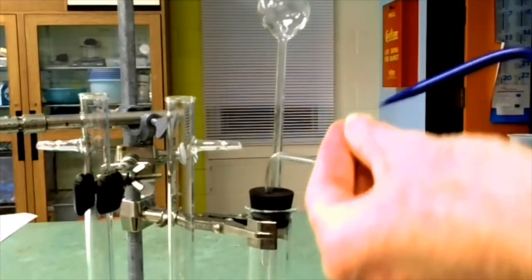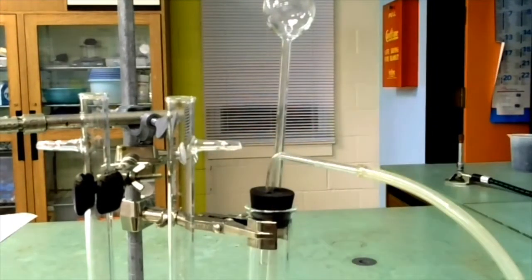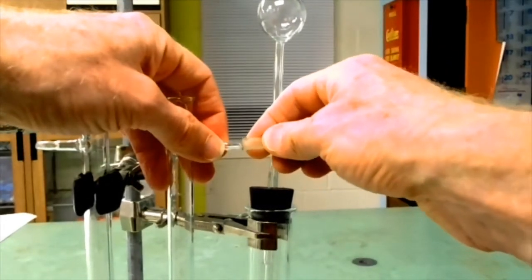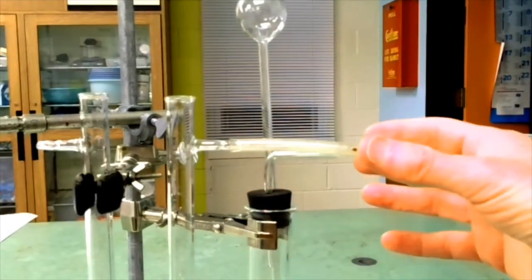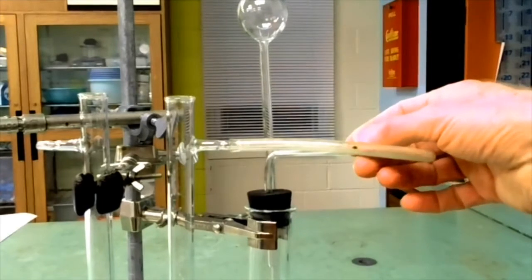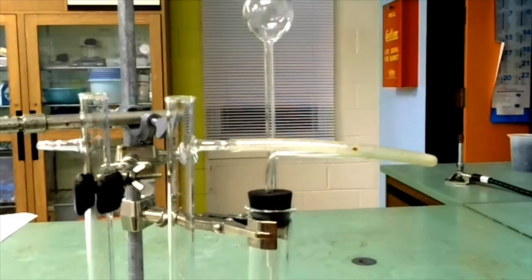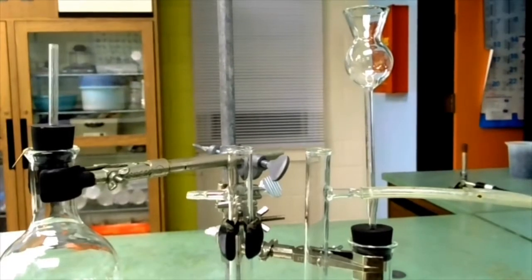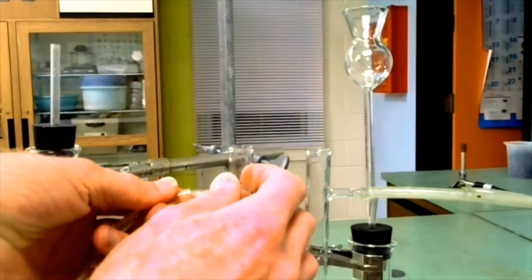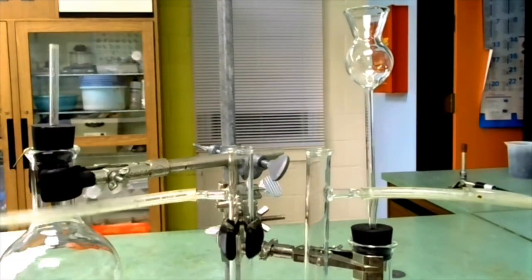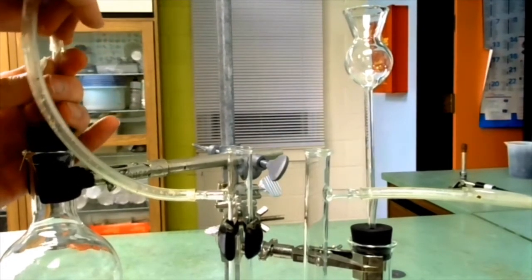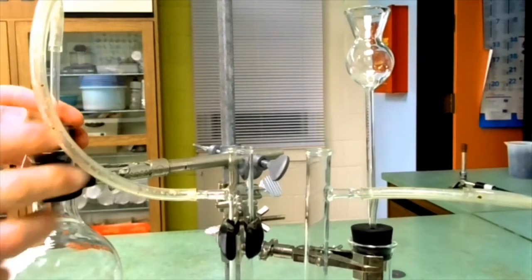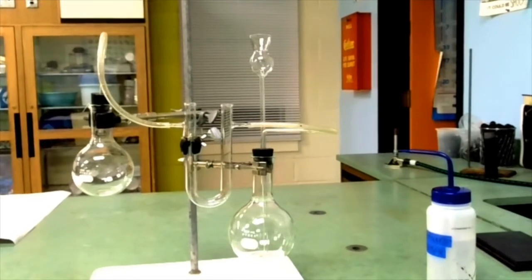Moisten and make sure that the plastic tubing isn't putting any strain on the glass tubing because the glass tubing is a weak spot. And we can do the same thing for the receiving flask. That looks like a pretty good setup.